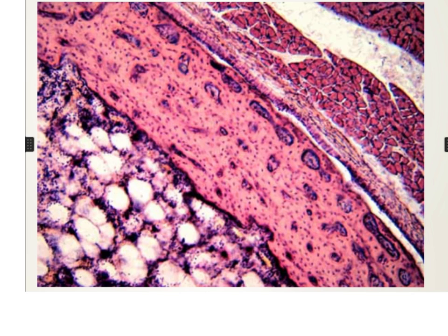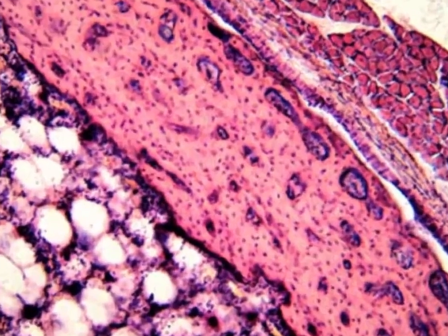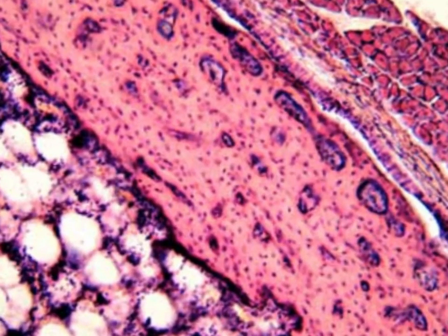The skeletal muscles are diagnosed by these polygonal cut transverse fibers, and you can see that the nucleus is peripheral in position. And in the middle area, the ribbon of the decalcified compact bone, you can diagnose the following: these Haversian blood vessels.